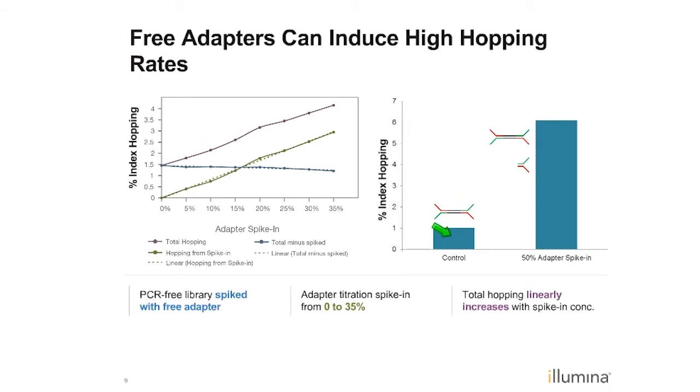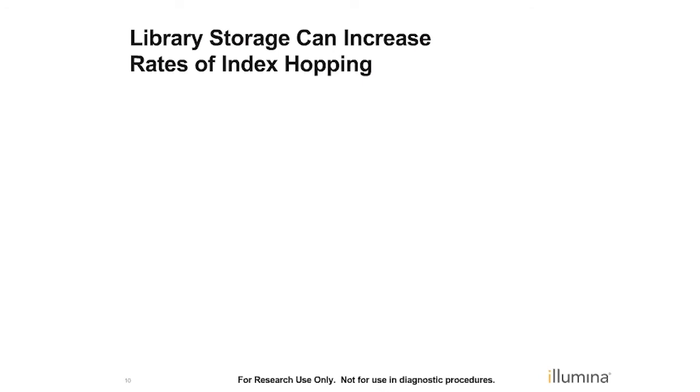And so you can see here what we think is part of the mechanism. This is the structure of the PCR-free library, the control library here. And what we believe is that when we spike in the free adapter, which has these sort of forked adapter ends, as we called them, which is similar to what we have with PCR-free libraries, we think that adding those together is part of the mechanism, probably not the complete mechanism, but the point is that having free adapter at these kinds of levels of 50%, we can induce extremely high levels of index hopping. And in fact, most all of the cases that we've seen in the field that reported levels up in the 5% or greater, it has almost always been due to the fact that they had very, very high levels of adapters that are free in the prep.